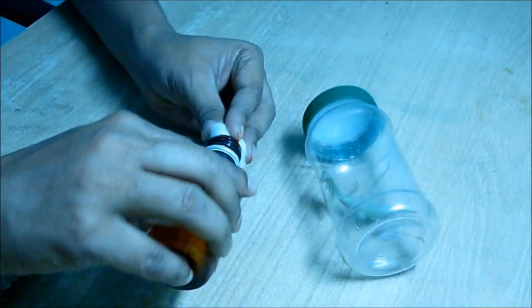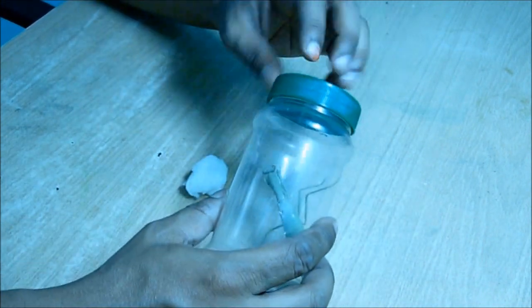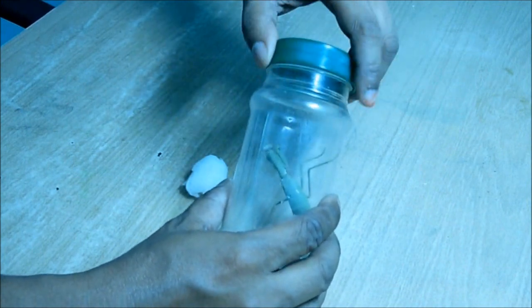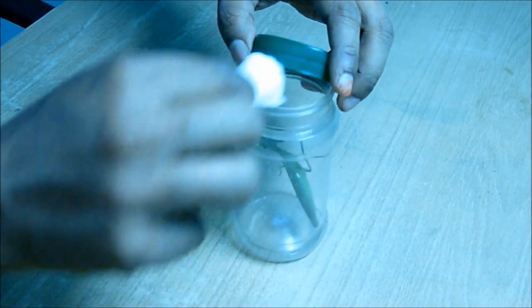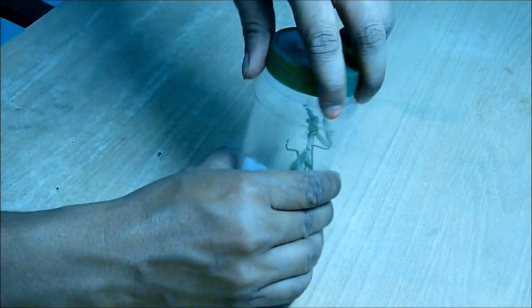To convert this jar into a killing jar, I took some surgical spirit in a cotton, put it inside the jar, and then tied the cap and kept it for around two hours aside.